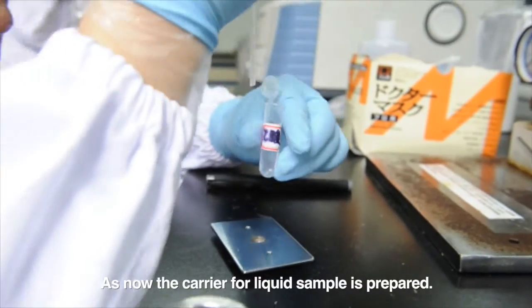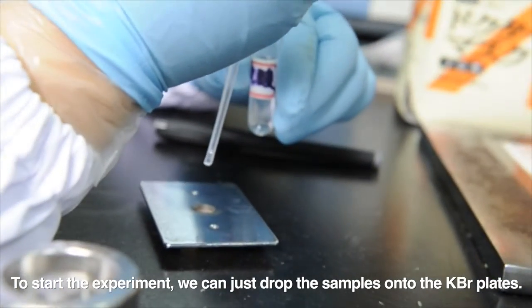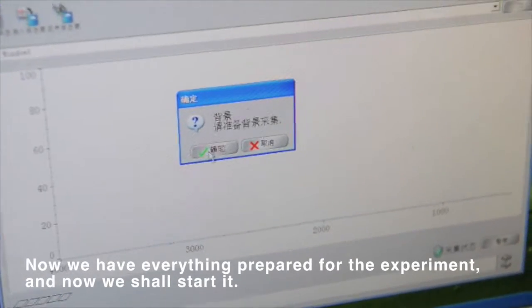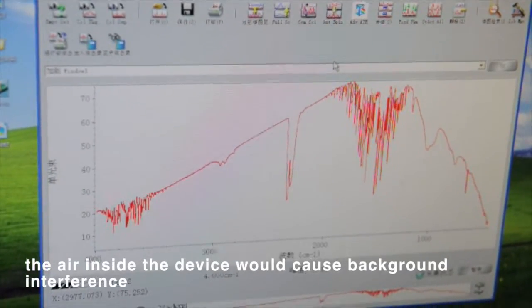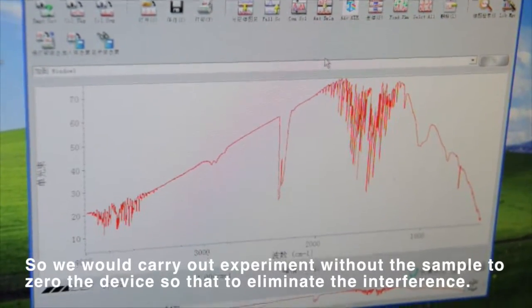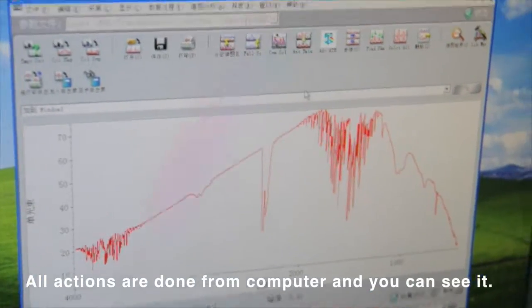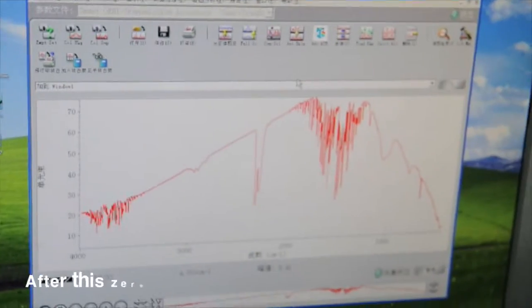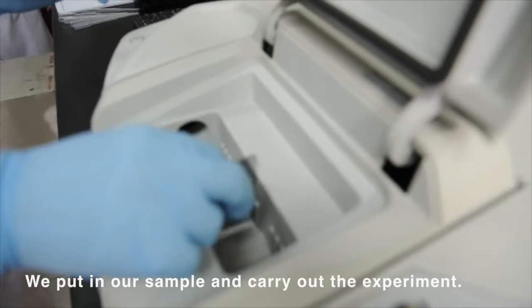Now that the carrier for the liquid sample is prepared, to start the experiment, we can just drop the samples onto the KBr plates. Now we have everything prepared for the experiment, and we shall start it. As we are unable to create a vacuum environment, the air inside the device would cause background interference. So we carry out the experiment without the sample to zero the device, so as to eliminate the interference. All actions are done from the computer, as you can see. After this zeroing experiment, we put in our sample and carry out the experiment.